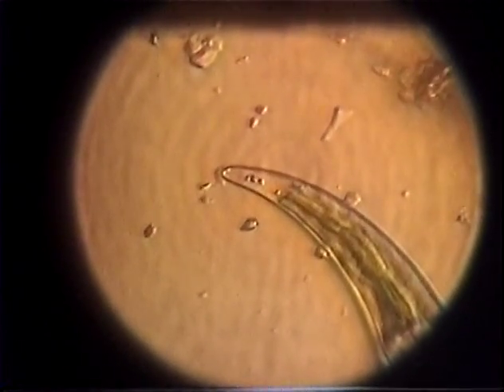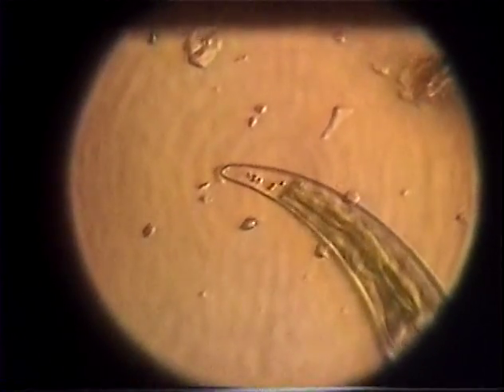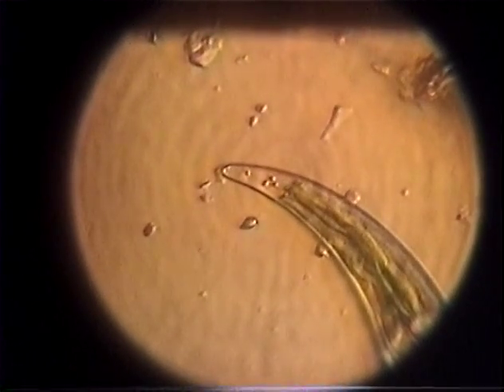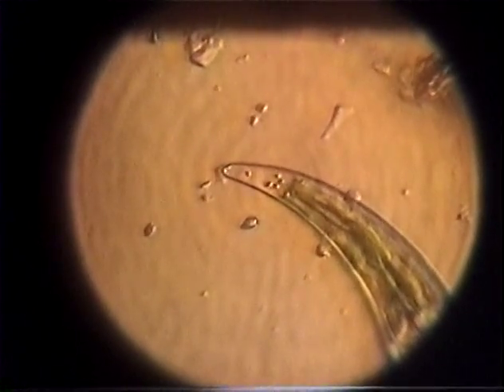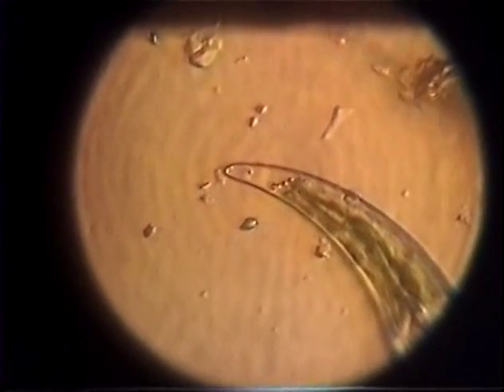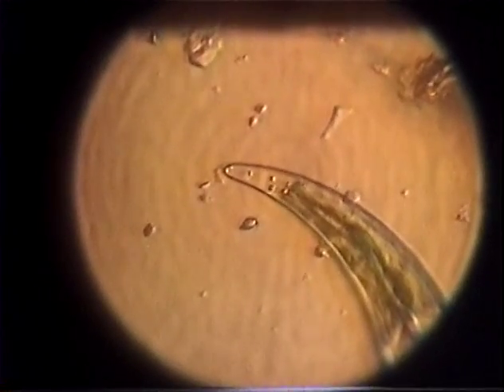All right, here we go. I'm going to get down in here and see what I can come up with. Bacteria are going inside of it. Wow, the difference between what we're seeing here and what I'm seeing here is night and day. It's very tiny in this image. Look at it, it's 10 times larger right there. You can come up here and look at this in a little while, but as soon as you start touching this, we end up with some problems.